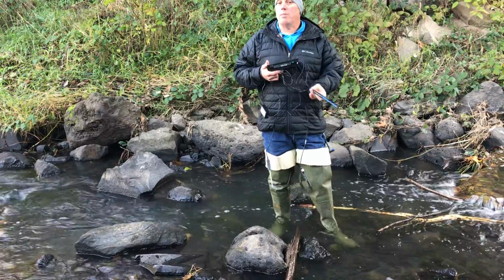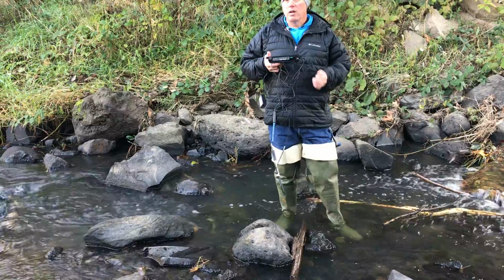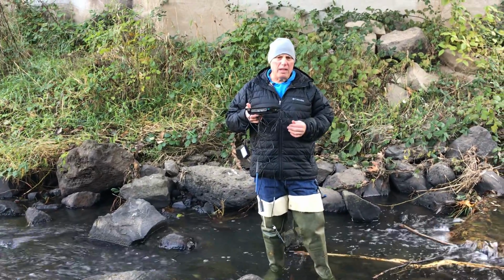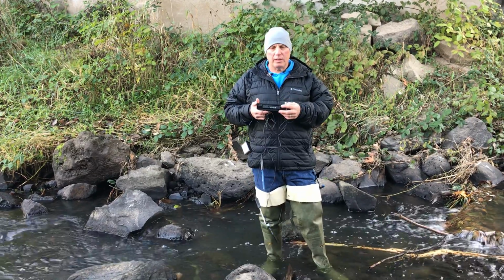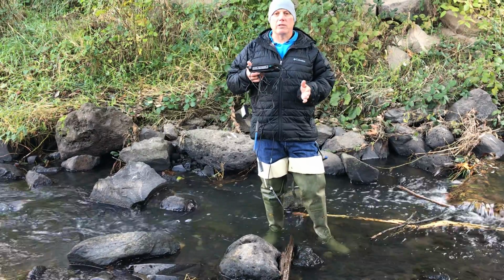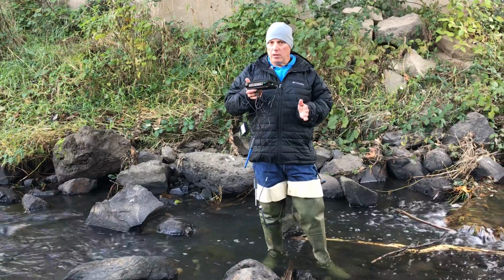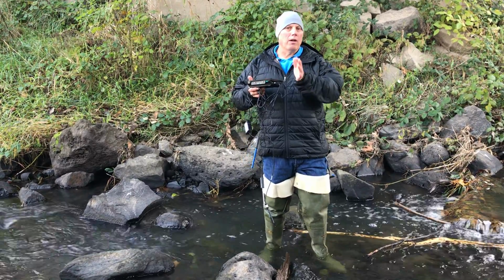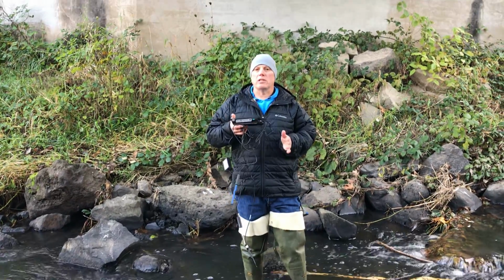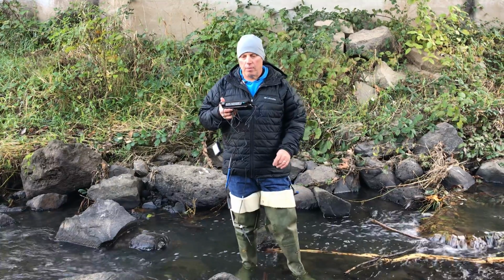For those of you who are unaware what pH is, this is just how acidic or basic the water is. And so this is a good indicator if we have pollution in the stream. If we have something that's too acidic or too basic, then we're obviously going to kill the fish that are in here. They can live with a little bit of tolerance, but we really like our pH for water at 7. It's not gonna be right at 7 because there's always something in the water changing that. A little high, a little low is okay. You get it too high or too low, then it's gonna be a problem. So let me check that.